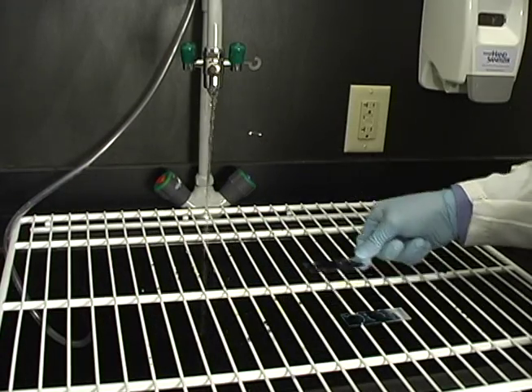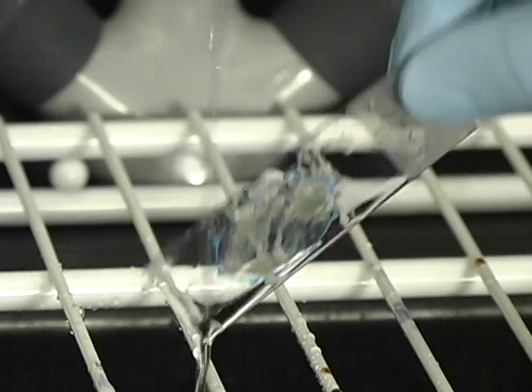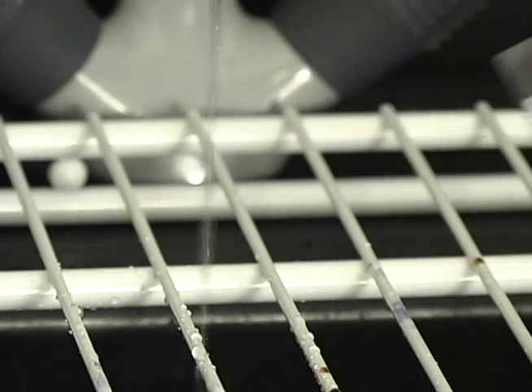Again, rinse each slide with water. Shake off the excess water and allow the specimen to completely air dry prior to reading. Now, your slides are ready to be observed using fluorescent microscopy.